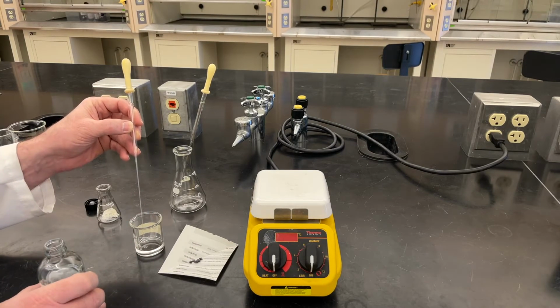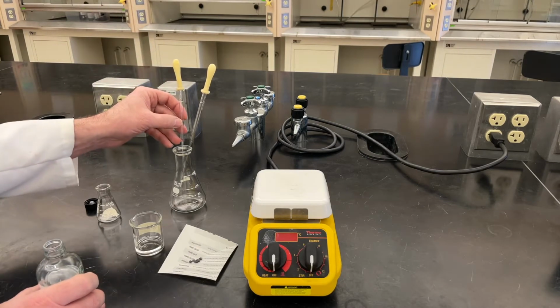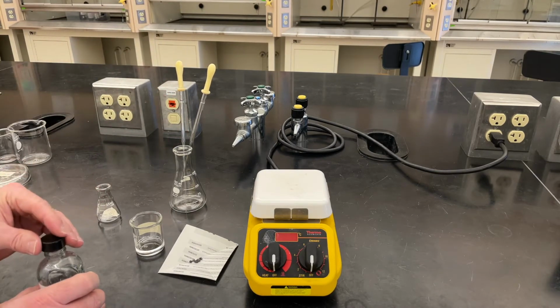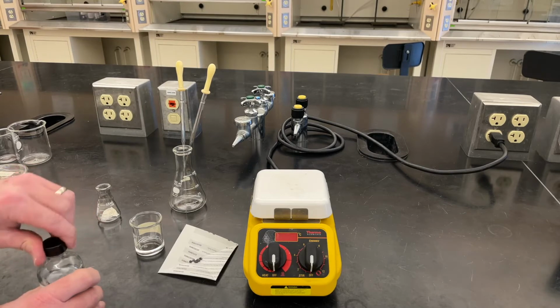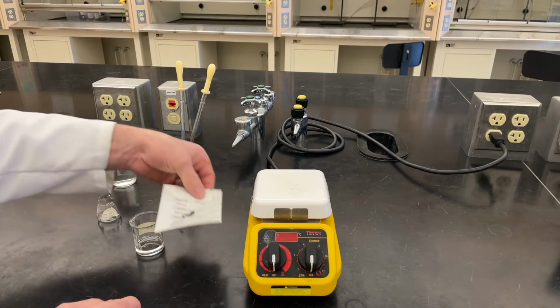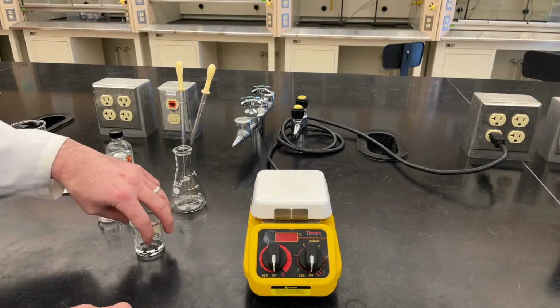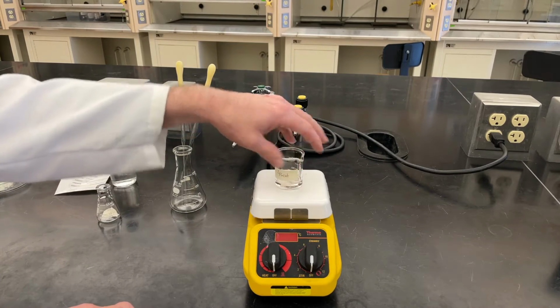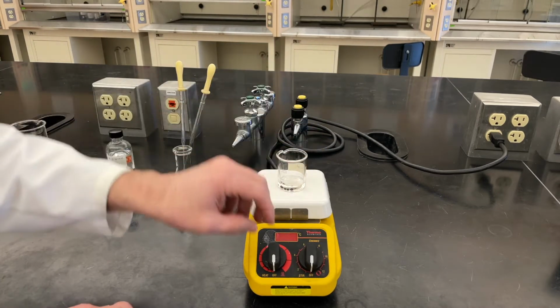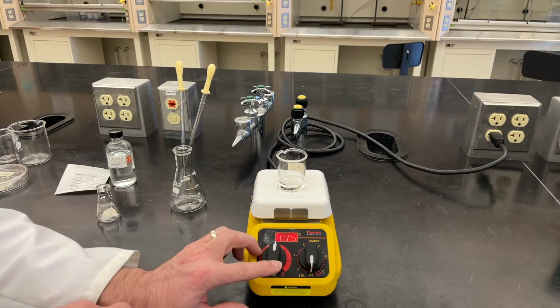It uses the surface tension of the liquid to travel down the pipette. Just a nifty little trick. That should give me plenty of 2-propanol. And then I'm going to throw in a couple of these boiling stones, which are an inert material that will not dissolve into my 2-propanol. I'll set that directly on the hot plate, and we will heat that up. I'm going to set the hot plate pretty high.